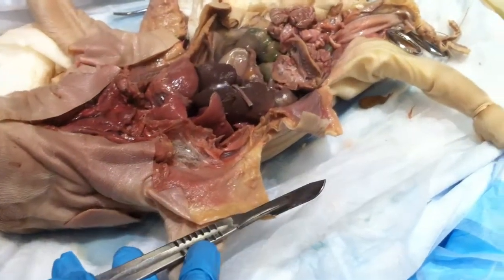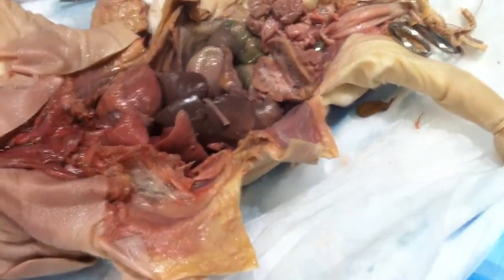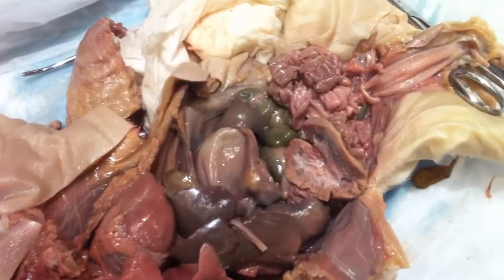I've done it so many times, I know what depth it's at, and I probably don't even think about it. But the best way is to be real shallow with it.